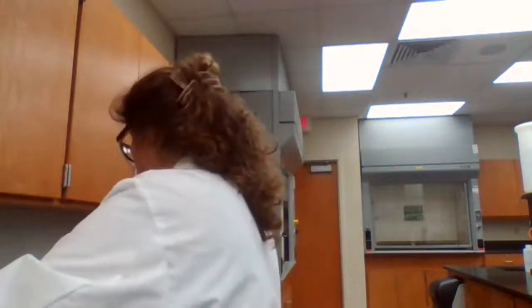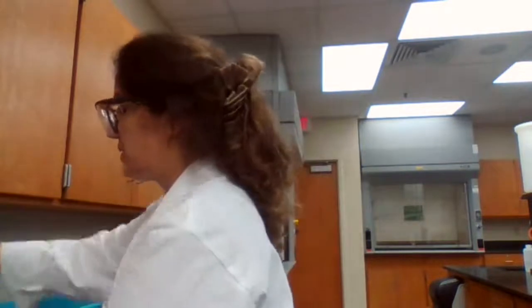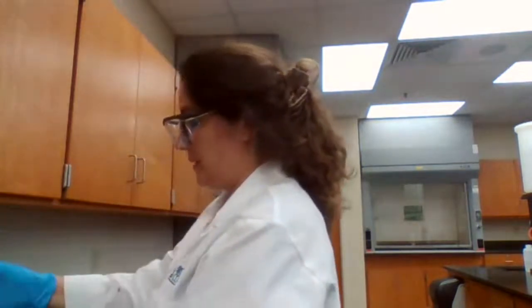Make sure that my test tube is balanced. We're almost there. Stay balanced. And centrifuge.